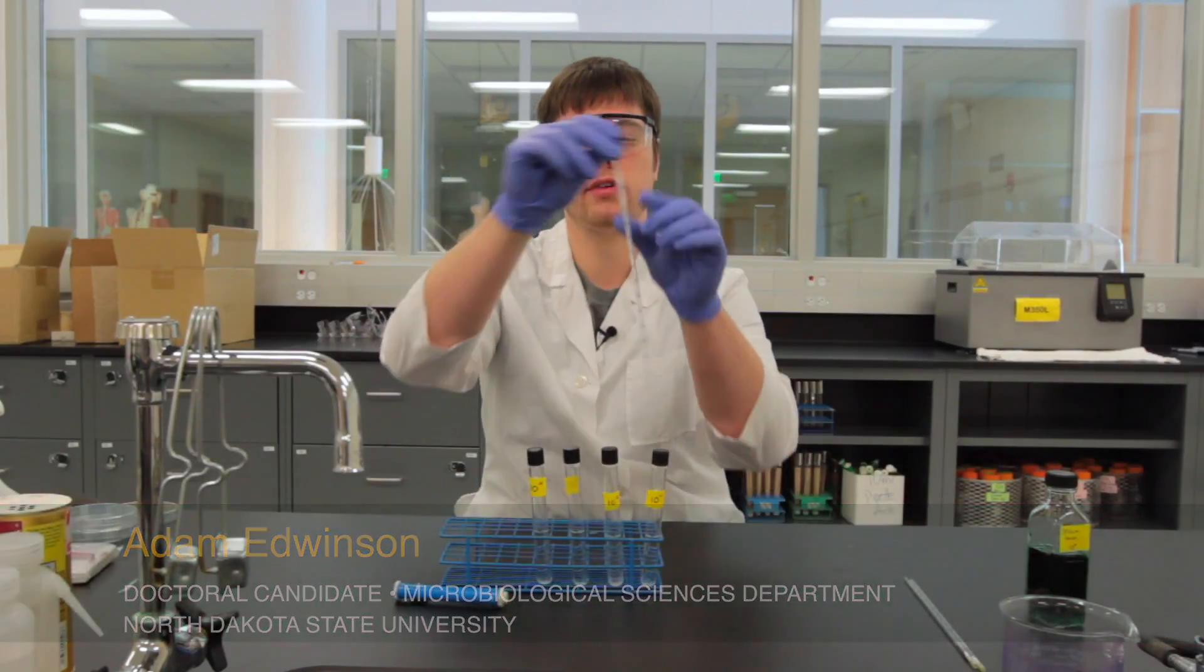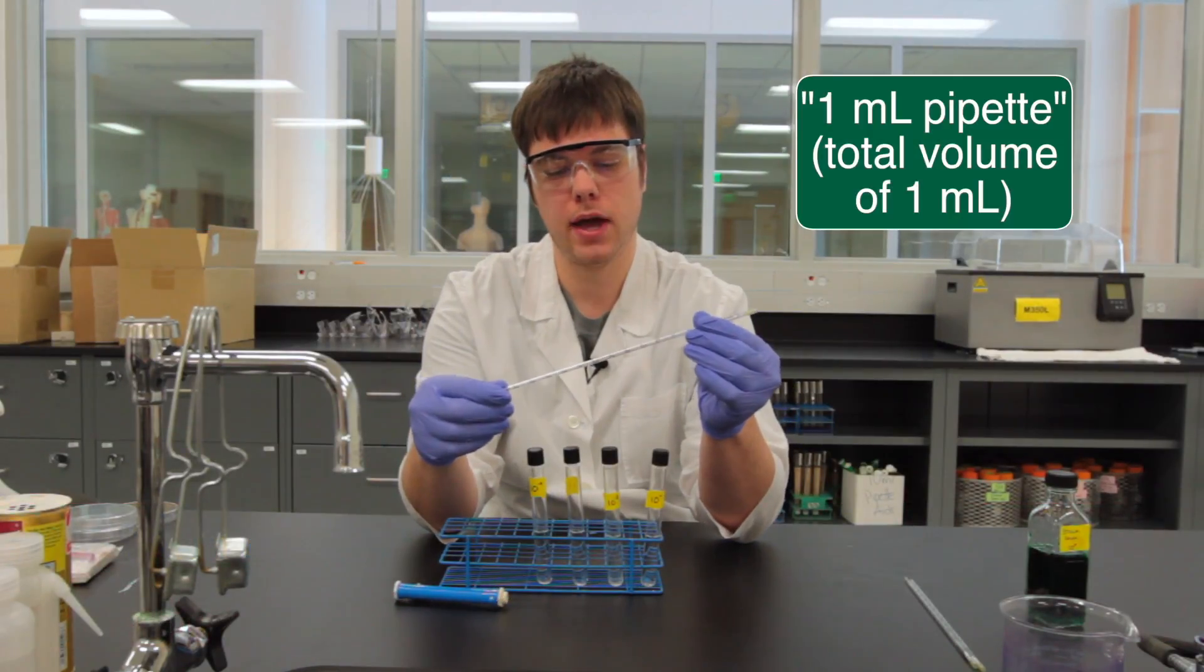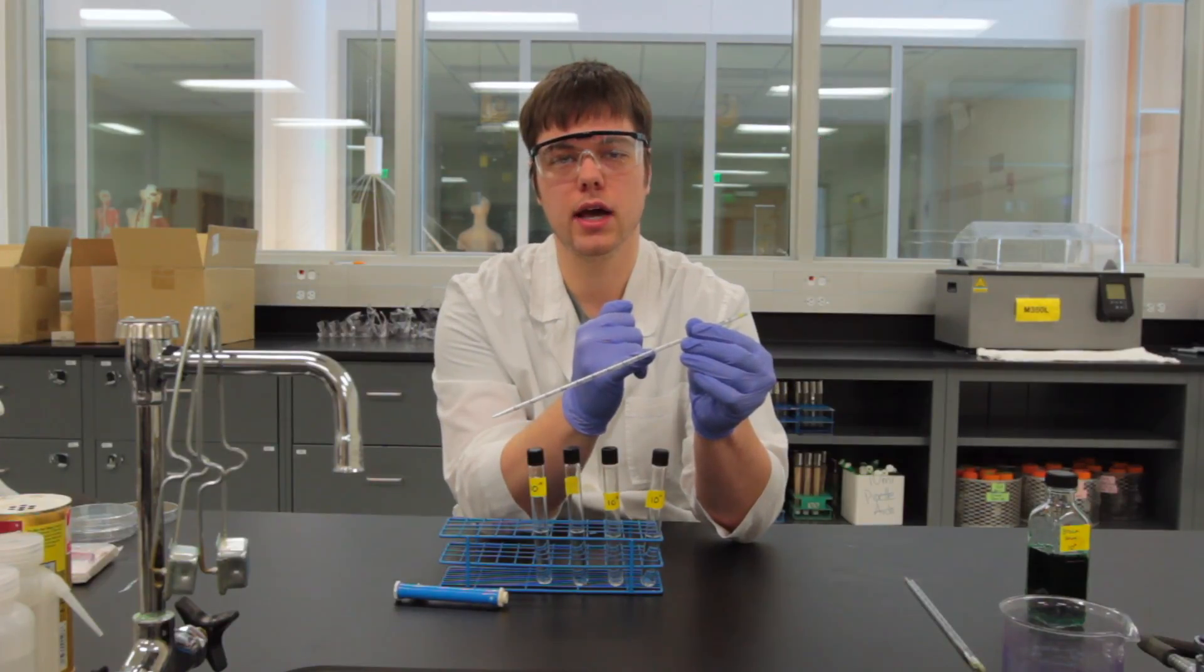We will also need a plunger and we will need pipettes. These pipettes are 1 mil pipettes. Notice how these 1 mil pipettes go up and end at a zero line.